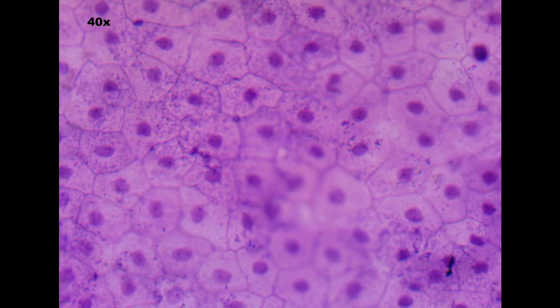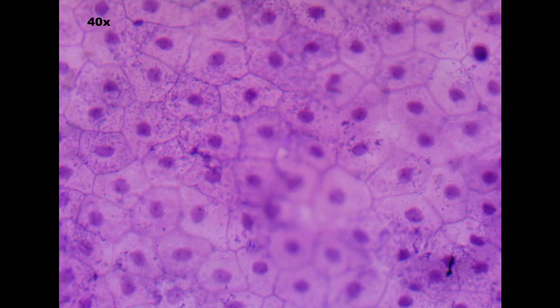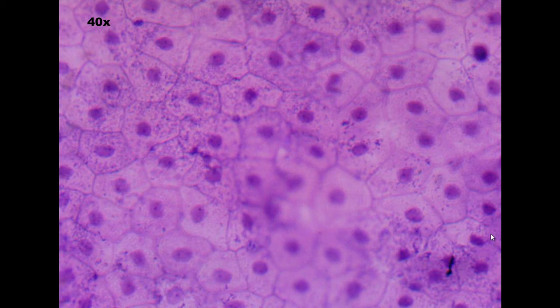This one: does the tissue have cilia? No. Is it a single sheet of cells that are irregular? Absolutely. That means it's simple squamous.